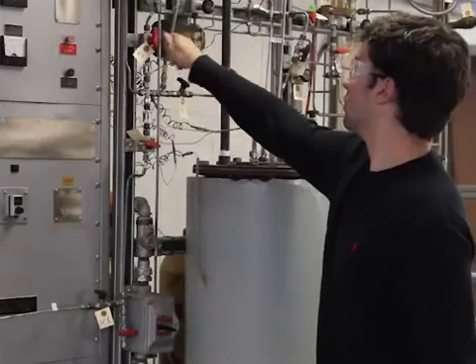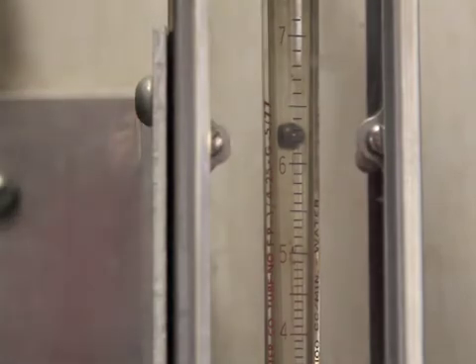Switch on the airflow to the sand bath, then ensure the rotometer consistently reads between 5 and 7 over the course of the procedure.